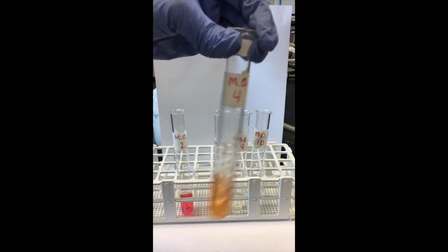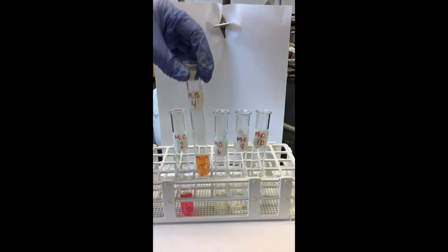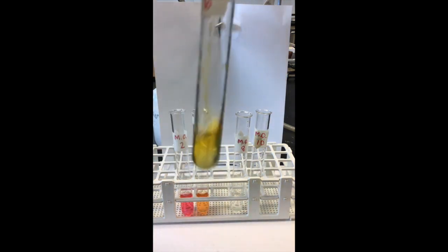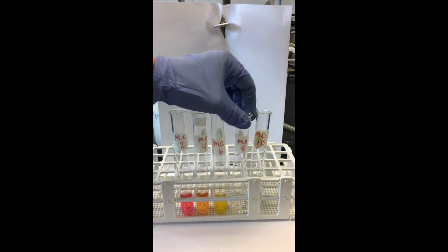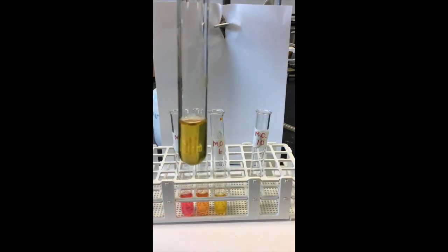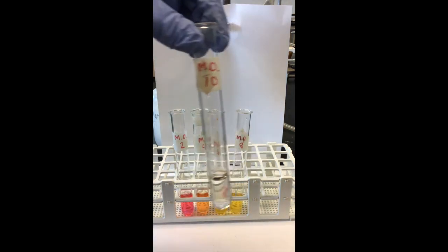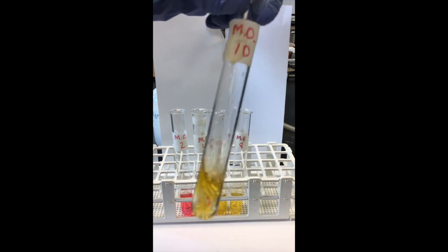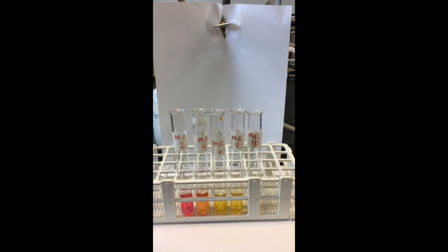This is pH 4, and then pH 6. The test tubes are labeled MO for methyl orange. It's always important that you start with clean labeled test tubes. That completes our series with the methyl orange.